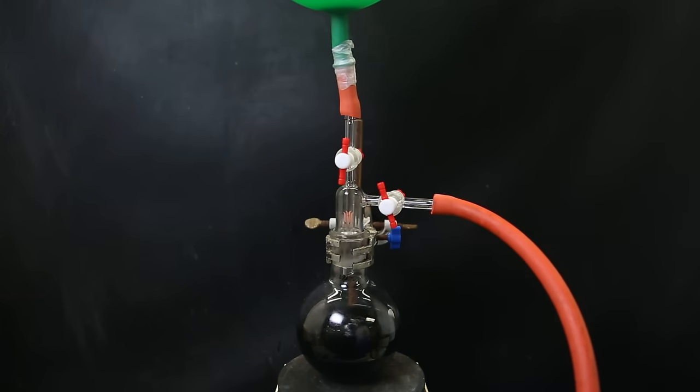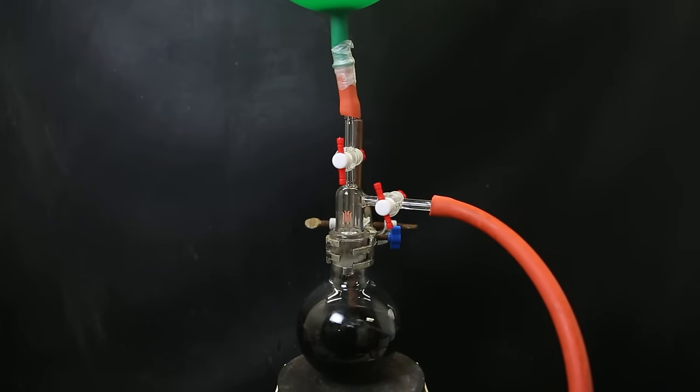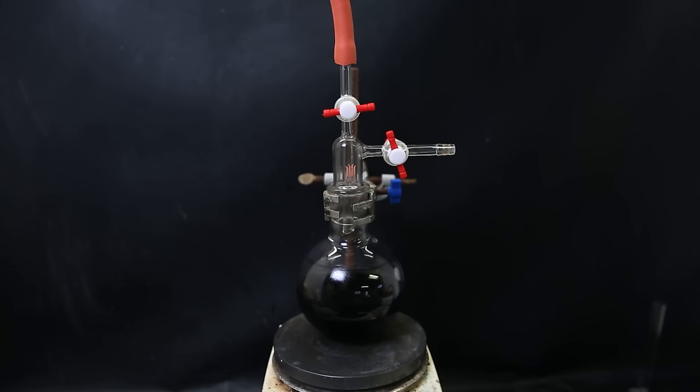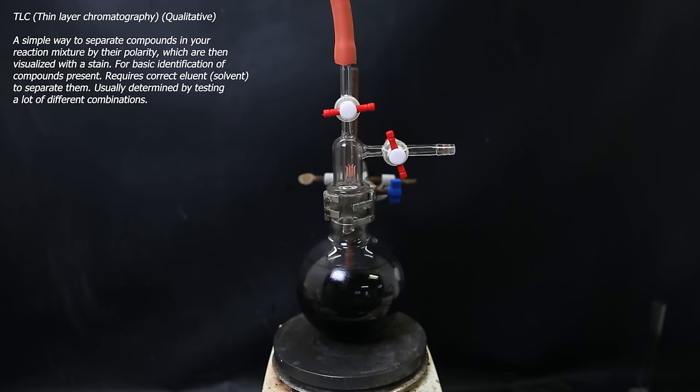Another thing is that hydrogen has a lot lower density than nitrogen, and it might mostly stay in the balloon, but I don't really know how gases behave. A way to track reactions like this could be via TLC, but I tried some different eluents to run it, and I didn't get the azide and amine to separate properly. I wasn't about to spend too much time on finding the perfect eluent, so I just let it do its thing and hoped for it to be finished.